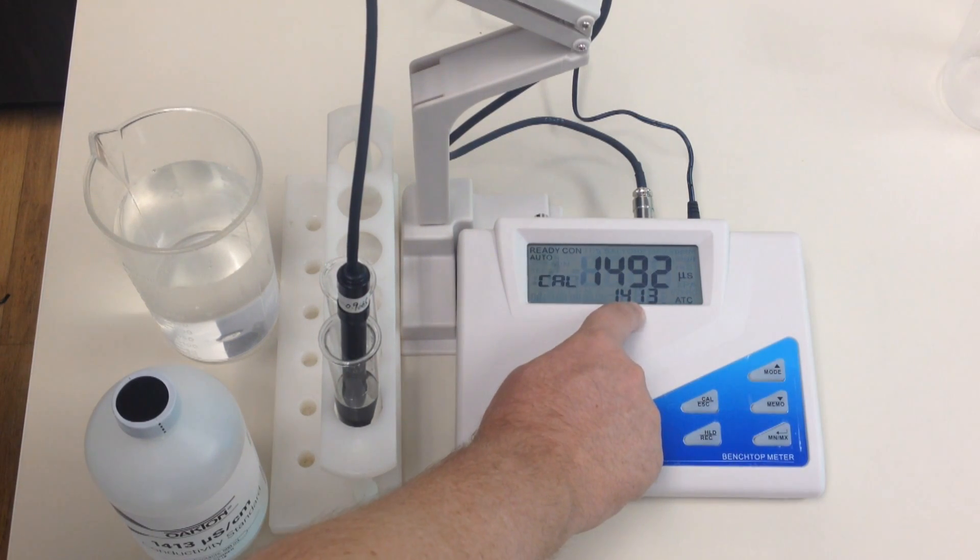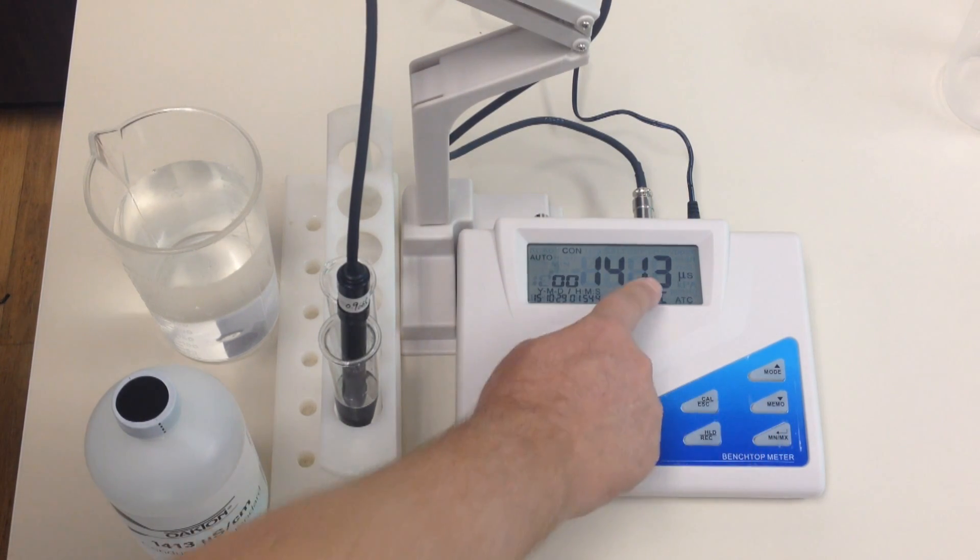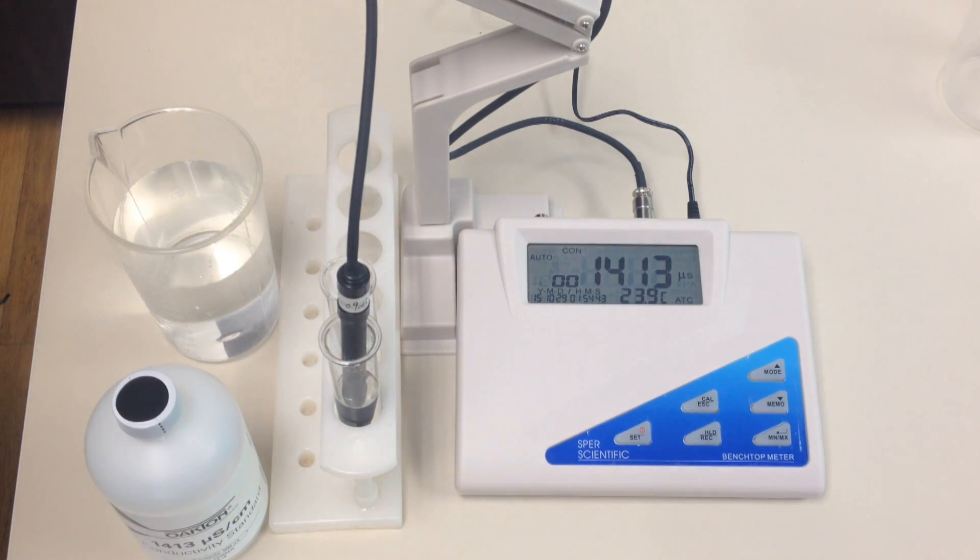1413, as you can see on the second sub-screen right here. I hit the confirmation, and now you can see it's now reading at 1413, this meter is calibrated.